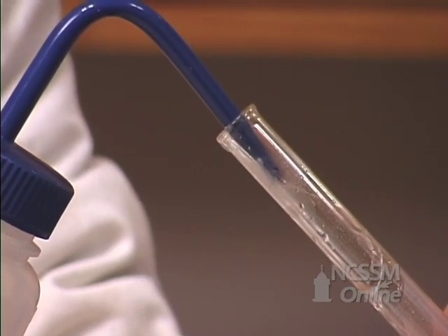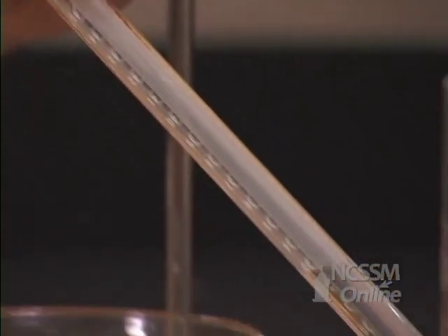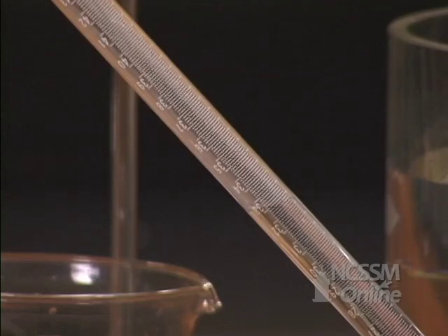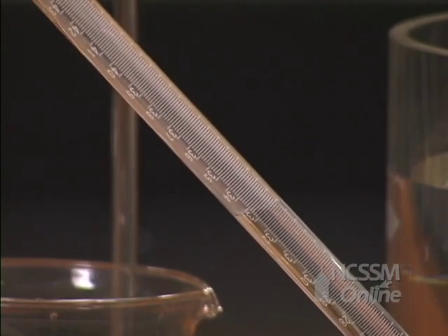I will then completely fill the tube with water. I'm going to add the water carefully, keeping the tube inclined, so that the less dense water will float on top of the hydrochloric acid.